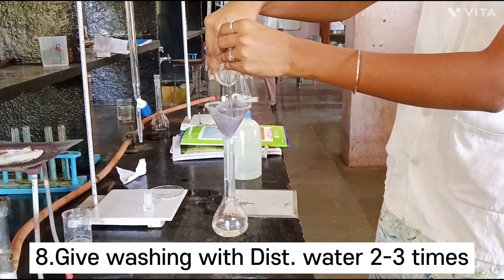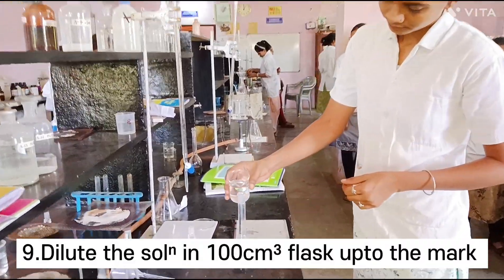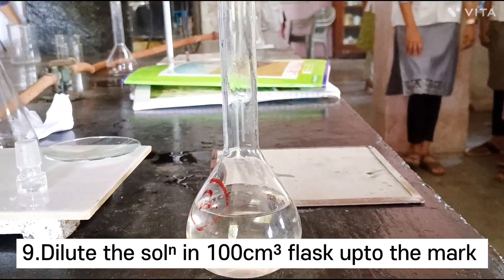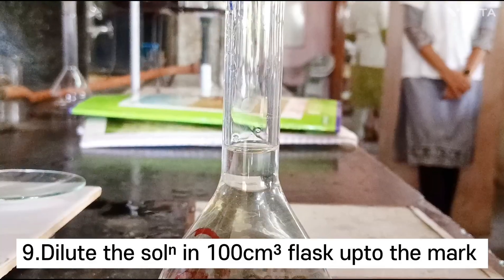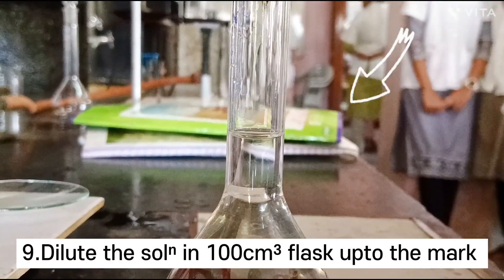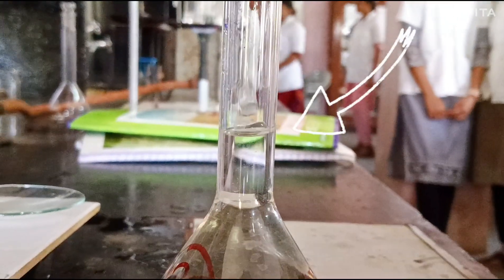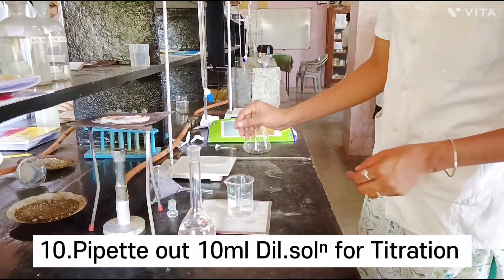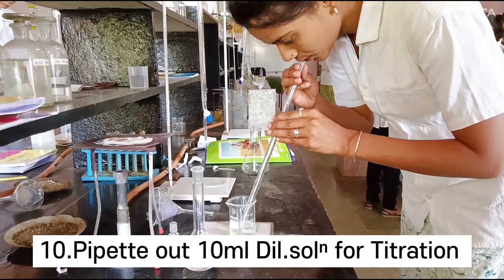After filtration, wash with distilled water 2 to 3 times. The collected filtrate is diluted using distilled water in a 100 ml standard measuring flask. After dilution up to the mark, pipette out 10 ml of the diluted sample solution into the conical flask for titration.